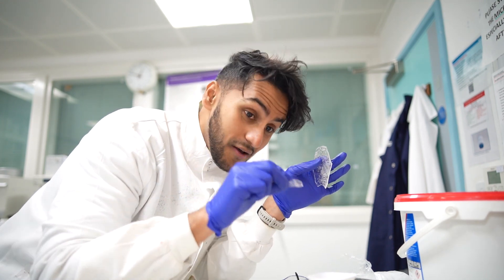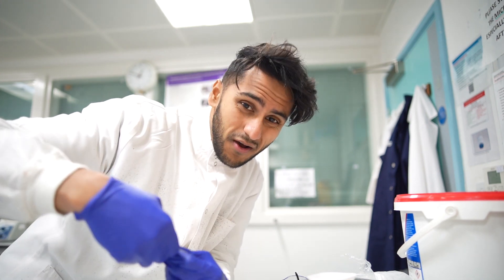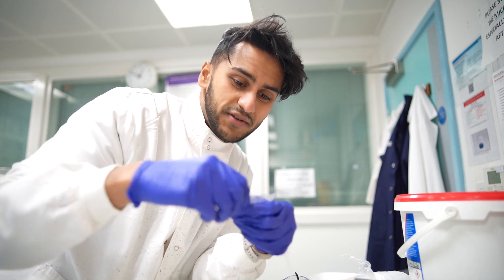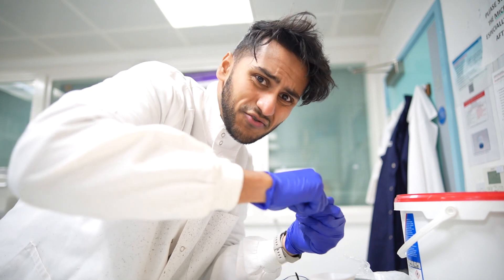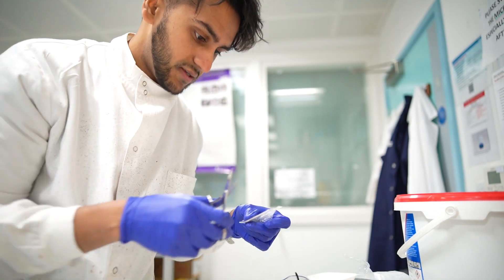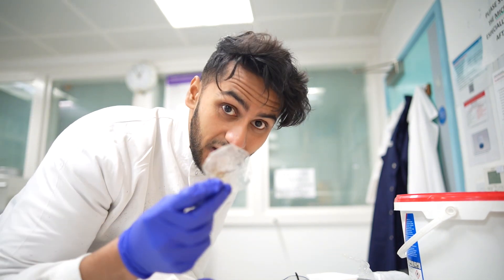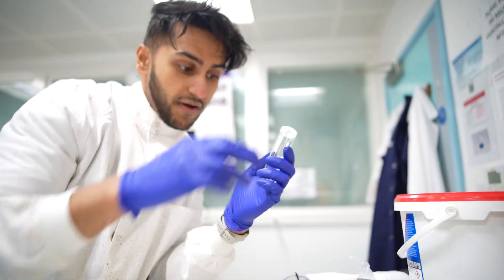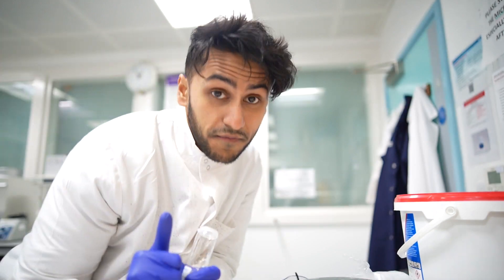I've lost a bit of polymer — that's 0.14 grams, 0.4 grams. Half of it is brittle and half of it's not, which is really weird. It is a thermally responsive polymer, so it's temperature sensitive. It's actually really hard to break — some of it's brittle and some of it's not. I might have to resort to using scissors or just trying to tear it. It's so strong. I found a brand new scissor just to cut this. Now I'm going to try to get 2 grams into this pot. That's a lot better. Some of it's actually brittle and makes the cracking sound. That is around 2 grams, and this is all the polymer I have left. Let's really hope this works — grab the vial with the chloroform and plop it in. You can hear that satisfying noise. Plop the lid back on and hopefully this time it works.